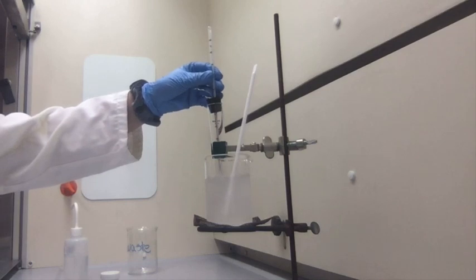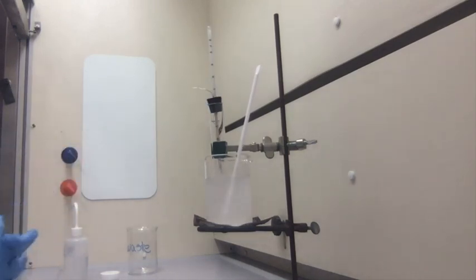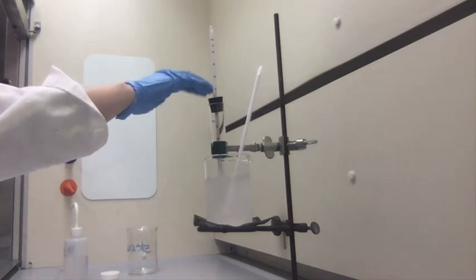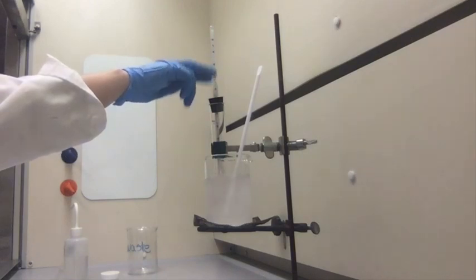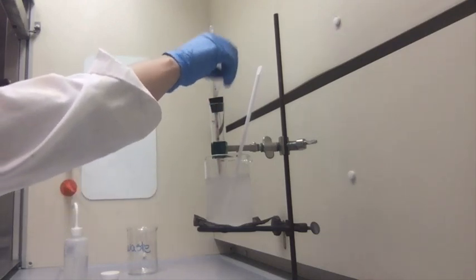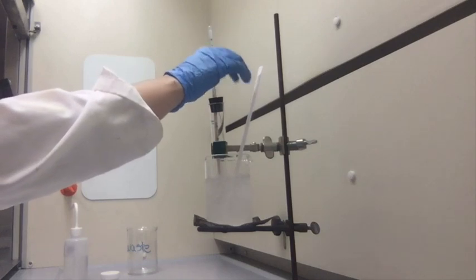It's still at 4.5 degrees Celsius. Still at 4.5 degrees Celsius.